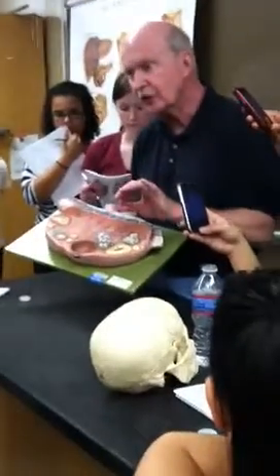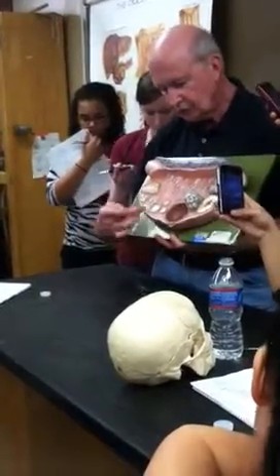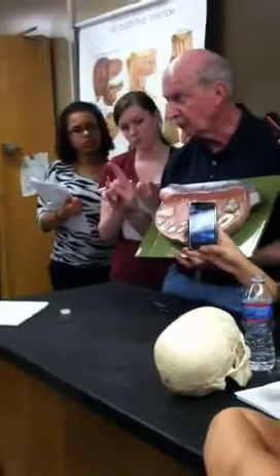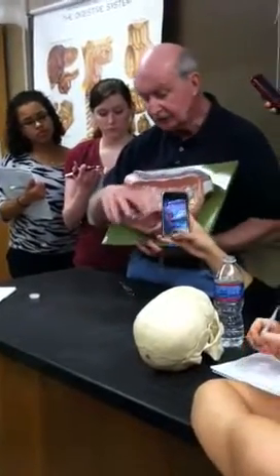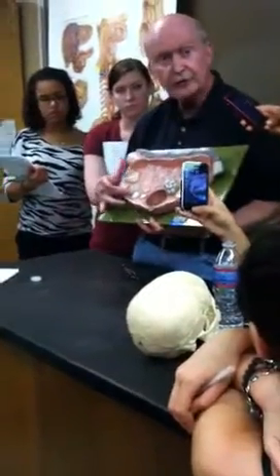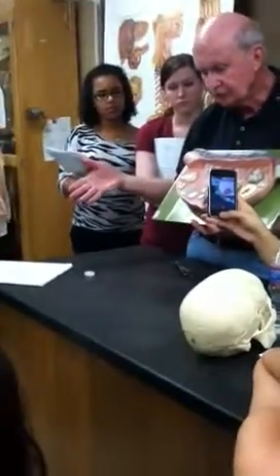So they're going to start to develop, and as they develop, obviously they're going to get bigger. They're going to go to about that size, and then maybe that size. Of the dozen or so that started to respond to FSH, typically one goes the full way. On about day 15, it becomes a tertiary follicle or Graafian follicle. Like I said, it's sitting on one surface of the ovary, kind of like a blister, ready to pop open. What about the other follicles that started to develop? Well, they become atretic. That simply means they start to disintegrate.